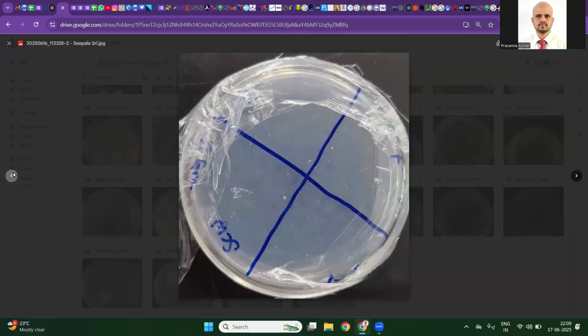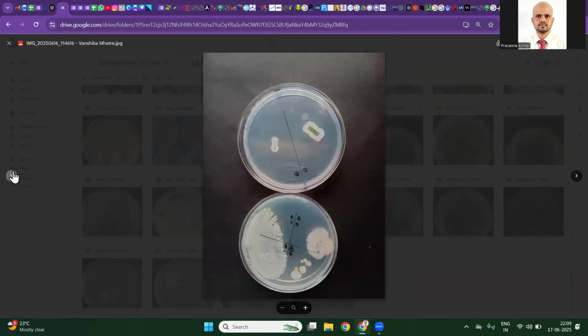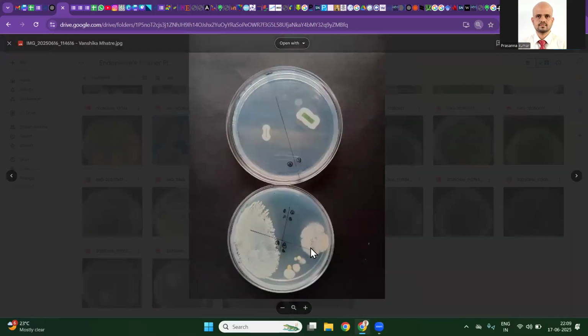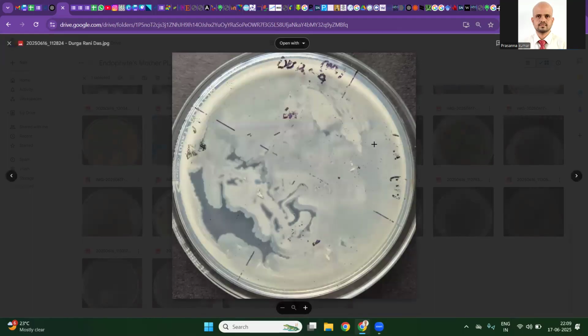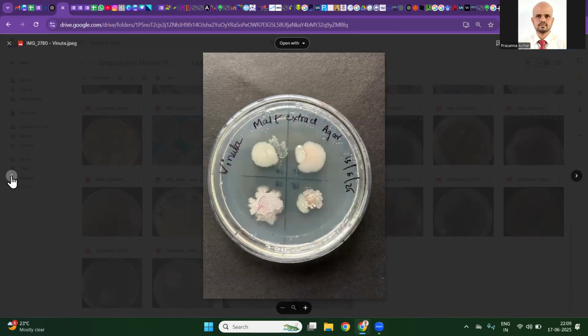We have to remove the cover and take a picture, not like this. Yes, the imprint has growth again. We cannot call them a proper endophyte, because even though it is coming from the leaf explant, if you see the imprint as a contamination, you never know. So we cannot confidently call them an endophyte. We have to make sure that the laminar control is very clean. Not like this, definitely. It has swarmers here occupying the entire plate. All four imprints have growth.